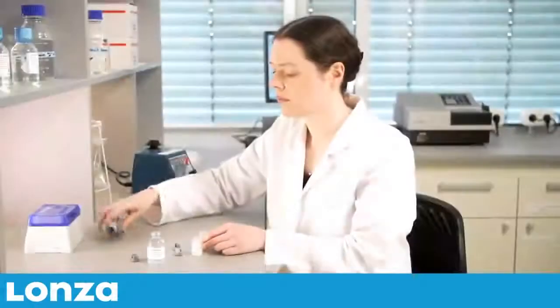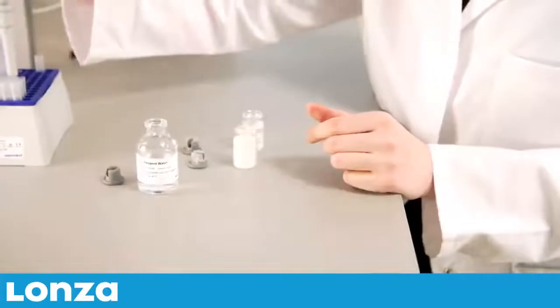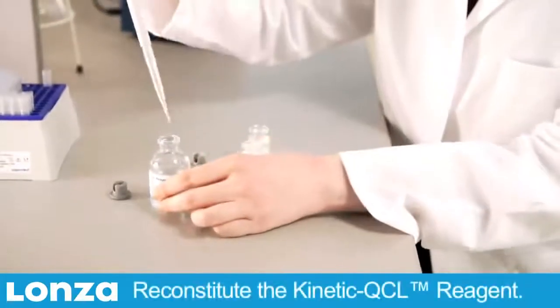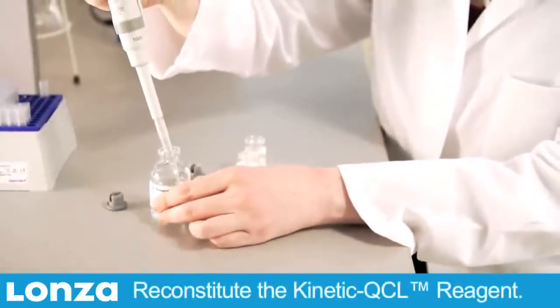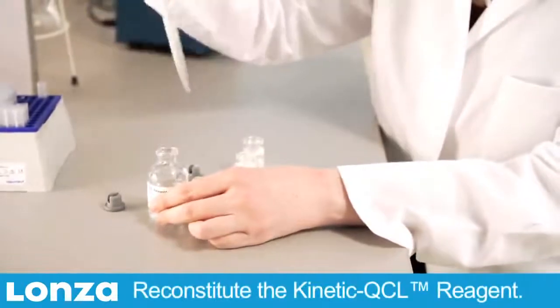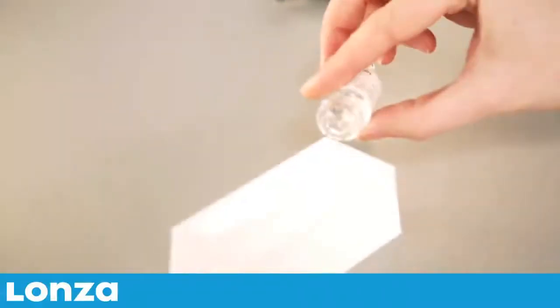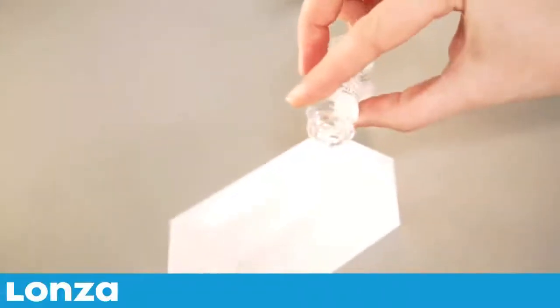Near the end of the incubation period, reconstitute the Kinetic QCL reagent with 2.6 mL of LAL reagent water and mix gently but thoroughly. Pour the reconstituted reagent into a reagent reservoir.